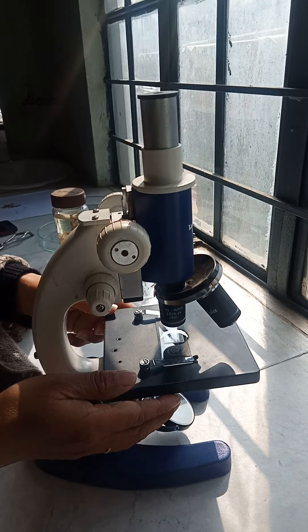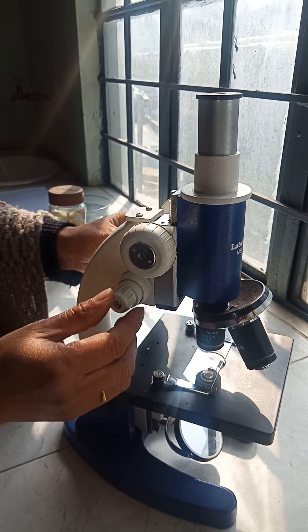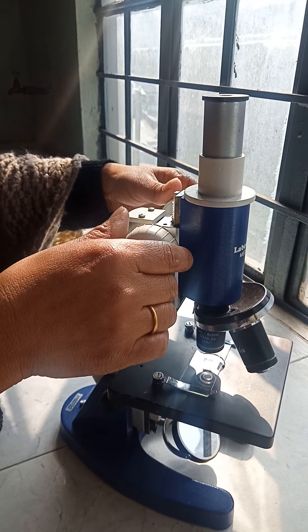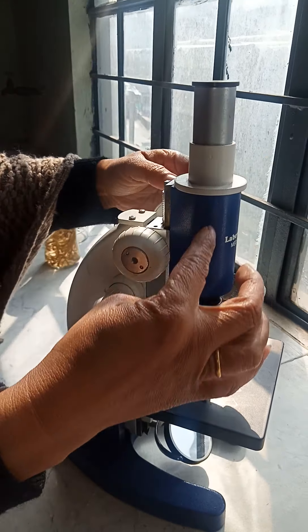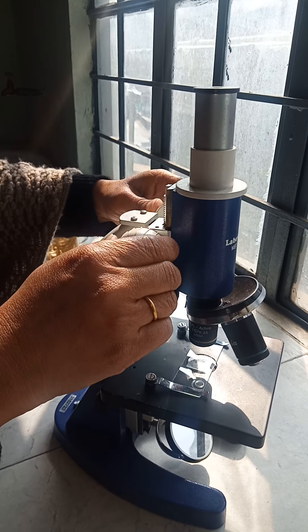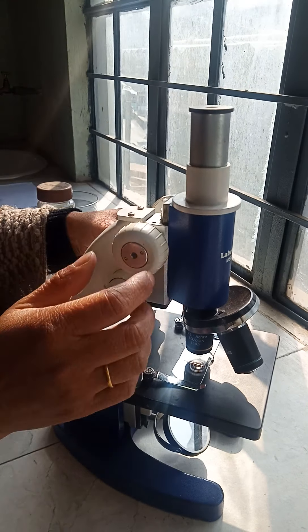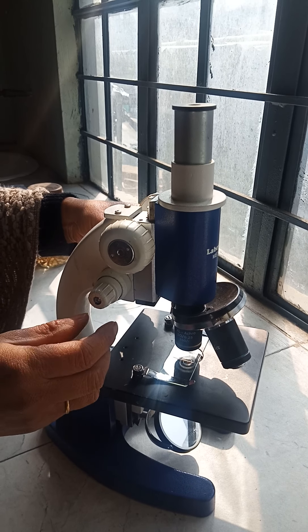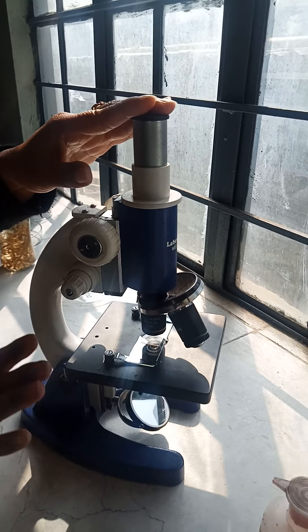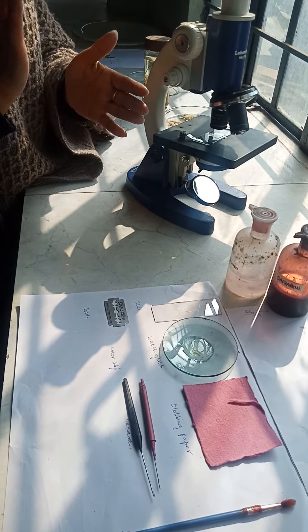There are two adjustments on the arm of the microscope. The smaller one is called the fine adjustment and the larger one is called the coarse adjustment. You can move the body of the microscope forward and backward with the coarse adjustment, and with the fine adjustment you can make the image clearer when looking through the eyepiece. These are the different parts of a compound microscope and the things you will need whenever you do your practical for algae, bryophytes, and pteridophytes.